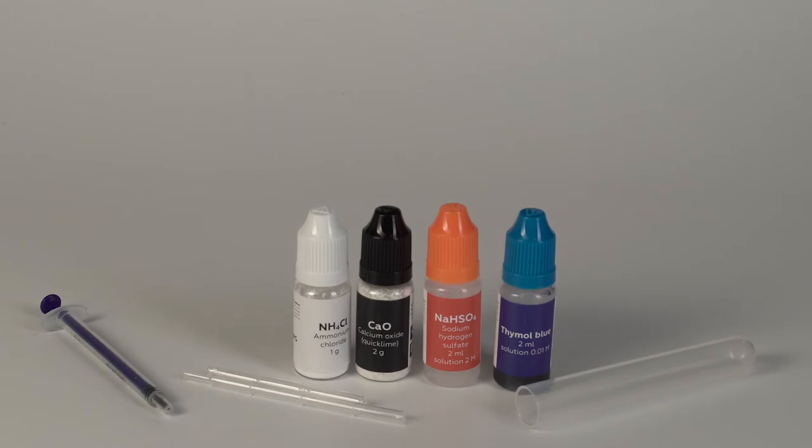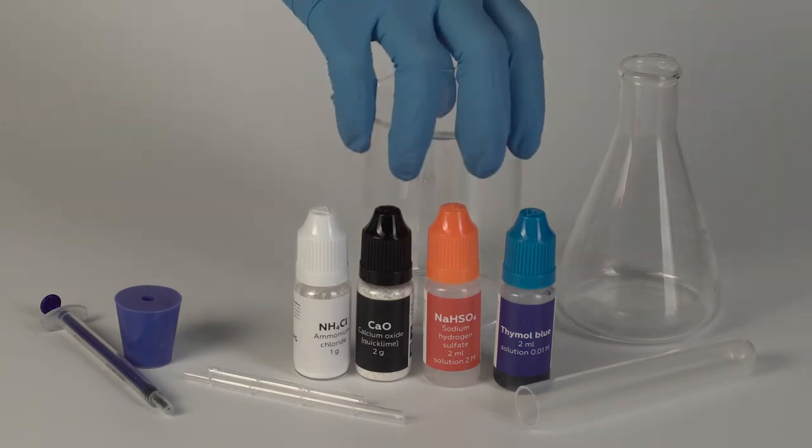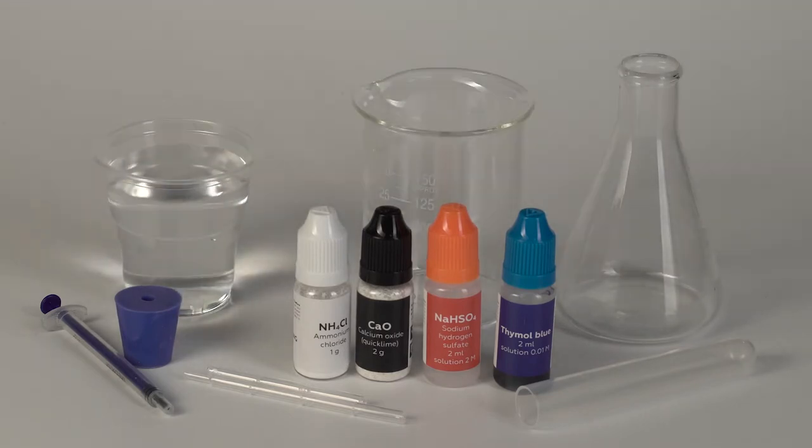From your starter kit, take the plastic stopper with one hole, the flask, and the beaker. You will also need some water in a disposable cup.